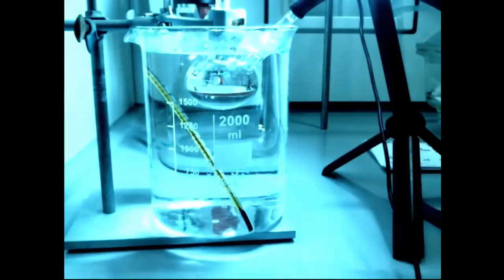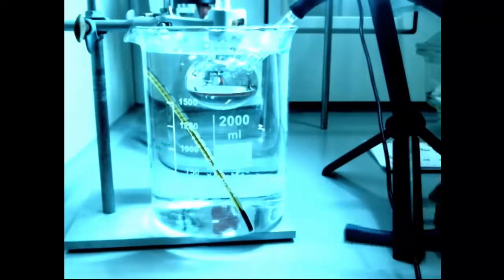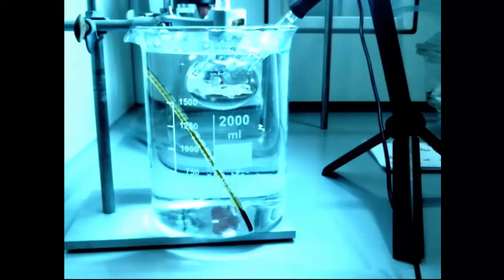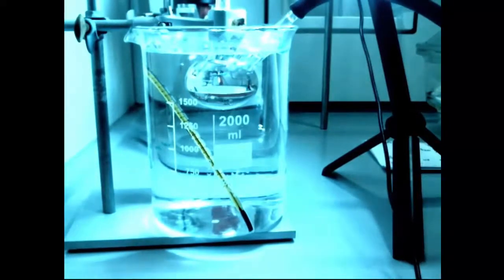Now I'm going to add a piece of stick to it to generate some surface for it to go in. There you see me drop it in. When I put the vacuum back on again, it boils instantly. It gets down to a decent vacuum. Ready? So the moment it all gets connected up and starts pumping, I have to connect all the tubes up. But now it will boil. There it goes, boiling as soon as the vacuum gets on. So we can see that the boiling happens at lower pressure, even at a mediocre temperature.